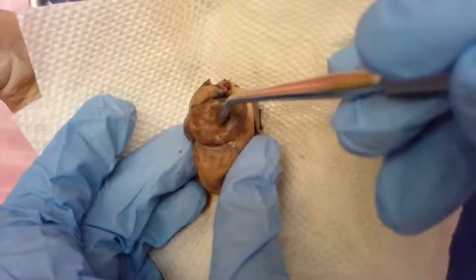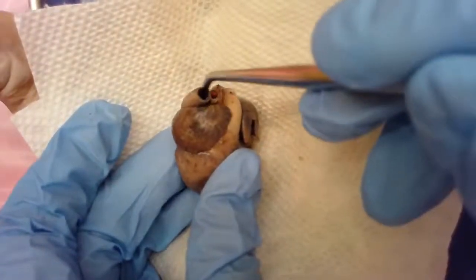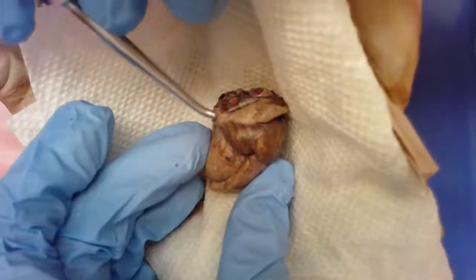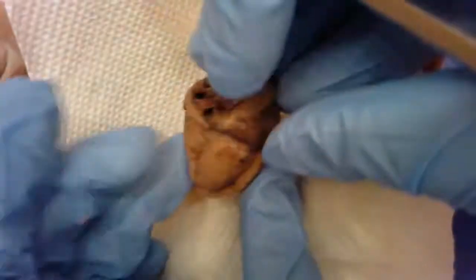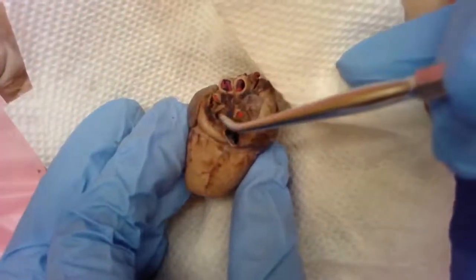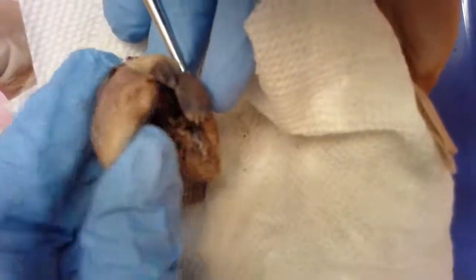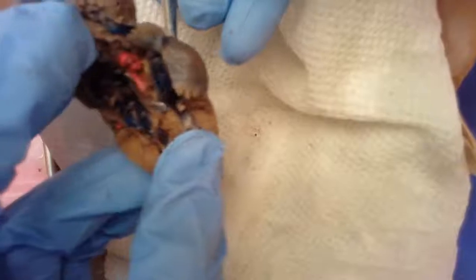Our entrance into the right atrium were the two vena cava branches. We had the anterior branch — that was this branch here. And we also had the posterior branch, which was down here, also going into this atrium structure. Now we can look on the back and see those entrances from the pulmonary veins that were leading into the left atrium. Here's one of them there. And if I flip this over and open up the heart, you can see that the probe is in that atrium structure, so you can see where that is.